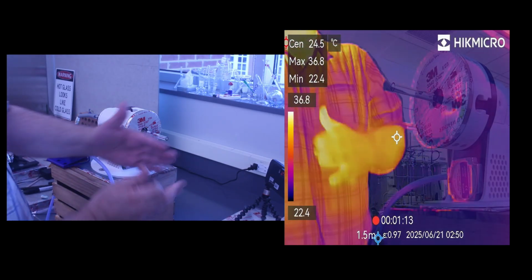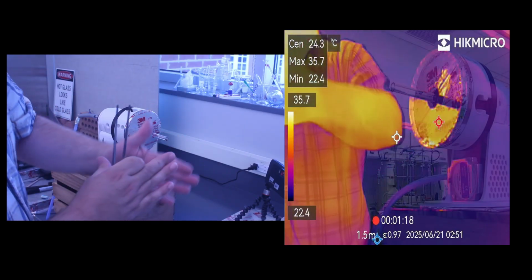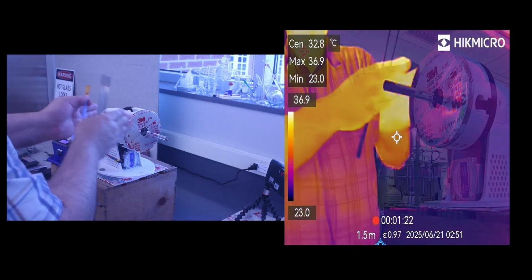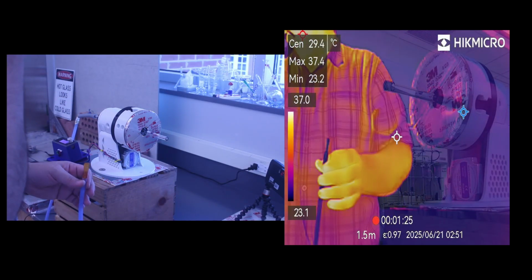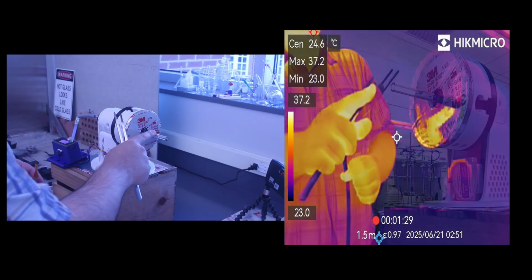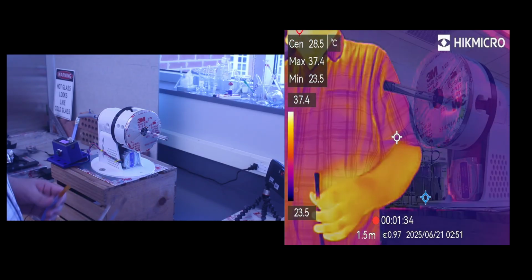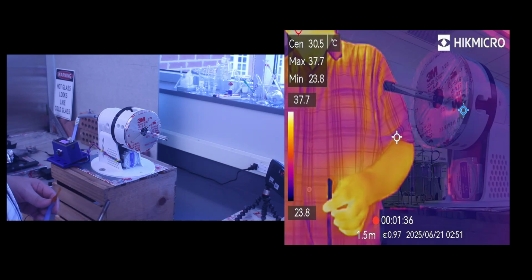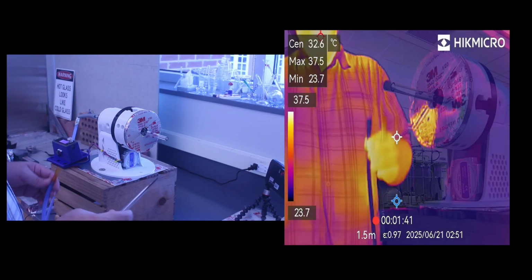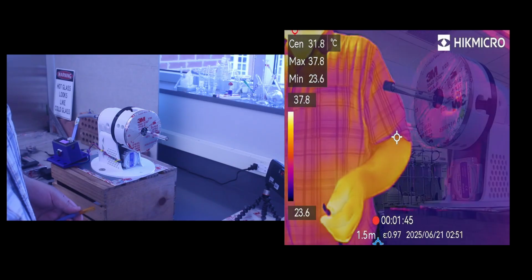After I've removed the glass, the tubing's going to have a pointy cone to it, and if I heat it further, it'll just collapse. So with my blow hose, I'm going to be able to puff air back into the glass tubing and restore its shape. My goal here is to make a test tube where the rounded end essentially stays the same diameter as the rest of the 11mm tubing. Later, I'll blow it out, making it into a bulb. With that, I'll use a different piece of glass.